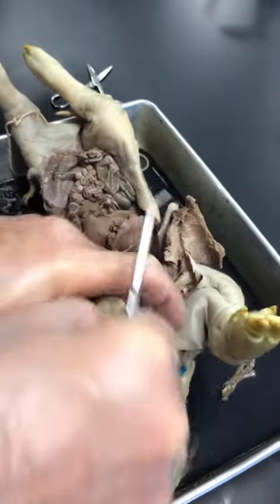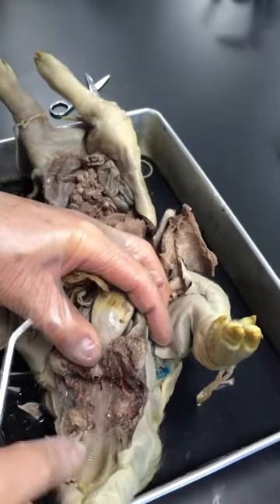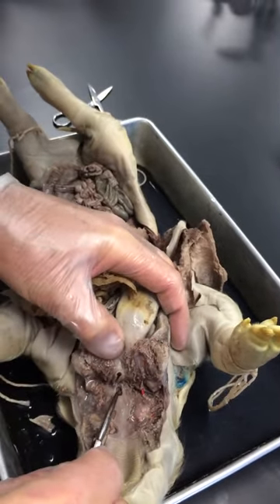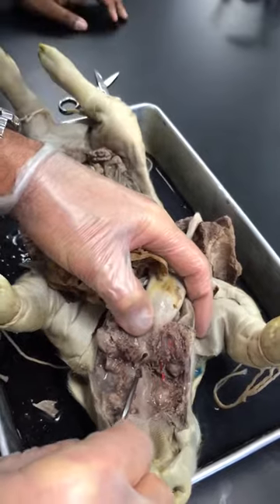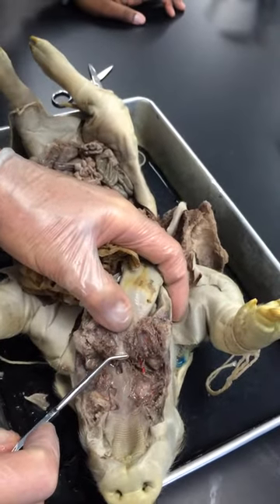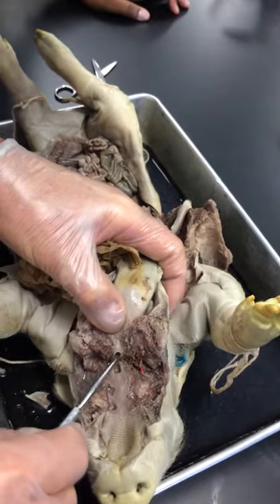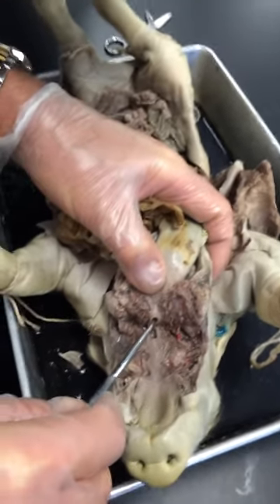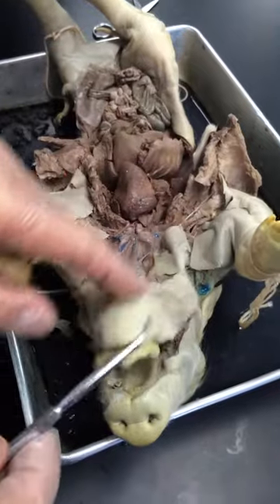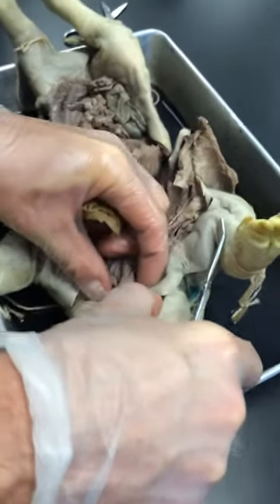Internal nares is the opening from the nasal cavity, which is above the palates, into the throat or pharynx — this hole right here. Epiglottis is the flap of tissue right here that covers the glottis, which is the opening when the animal swallows. Otherwise, this is open and air passes through the glottis into the larynx, which is the swollen region right here.